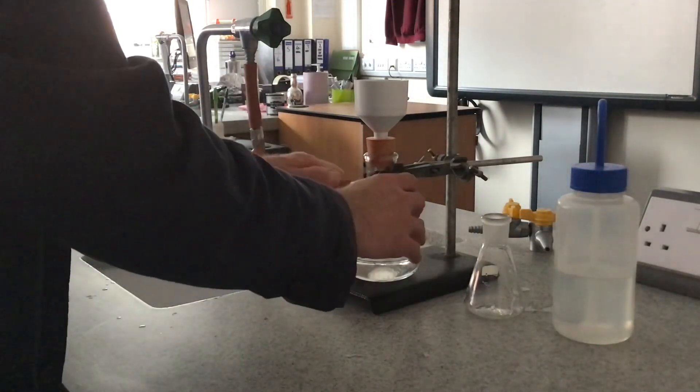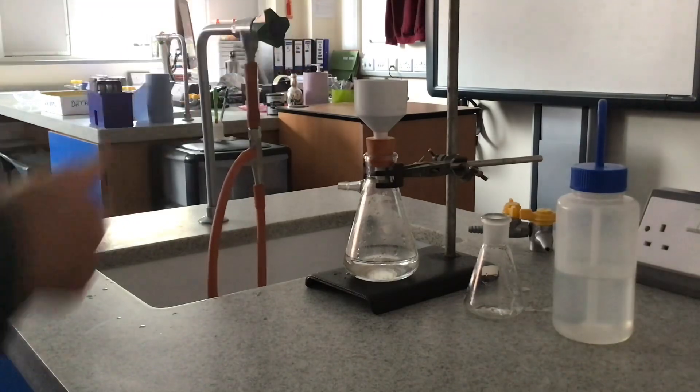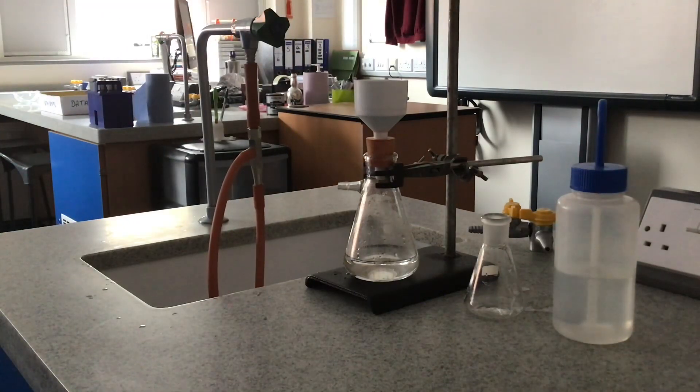I'm going to take the tubing off and then I can turn the tap off. I'll bring the camera closer to the Buchner funnel and you can see what's inside.